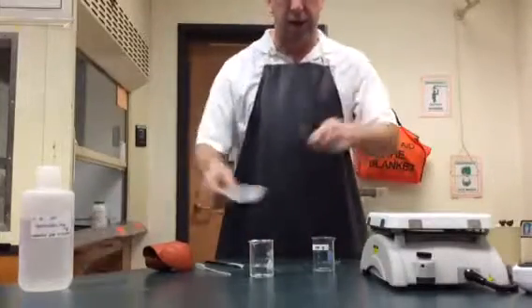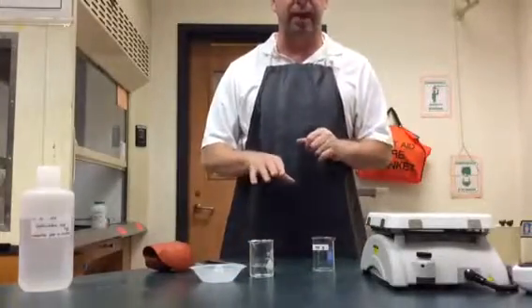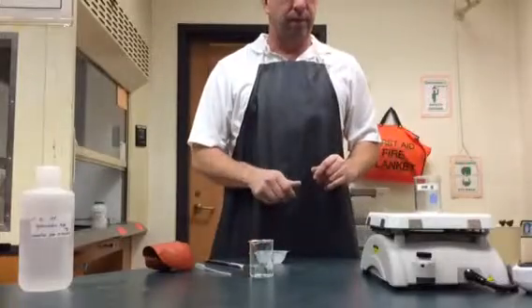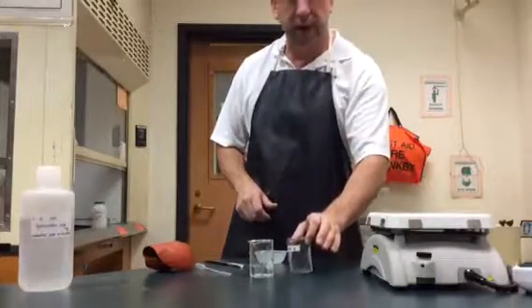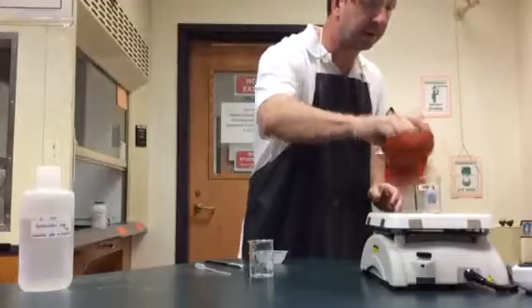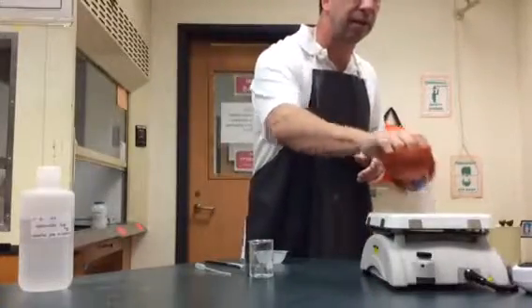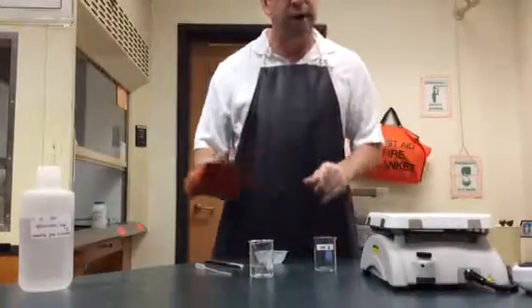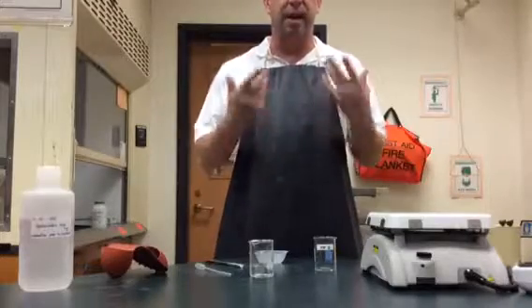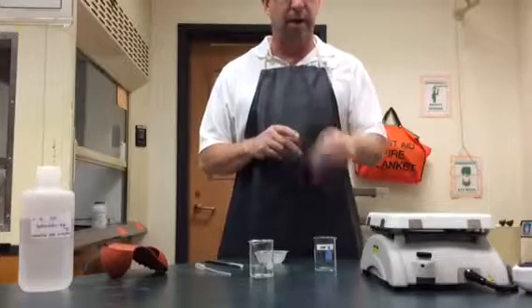The magnesium I'm going to go ahead and weigh — get in the habit of using a weigh boat. I'll have to double check my mass of the magnesium by weighing it very carefully. I'm also going to weigh my beaker beforehand, then sometimes use my hot hands to heat it up for three or four minutes at about setting four or five, then allow it to cool using the hot hands. I reweigh it again to see if it's the same mass — any moisture on there can be determined quantitatively, how much might have boiled away. This gives me two masses for my beaker, so I can feel more confident and reliable about my mass of the empty beaker.